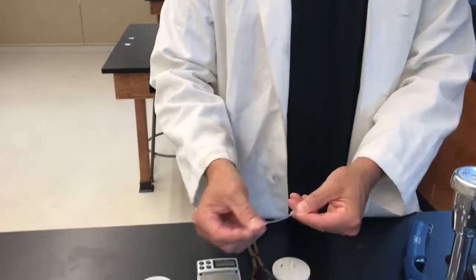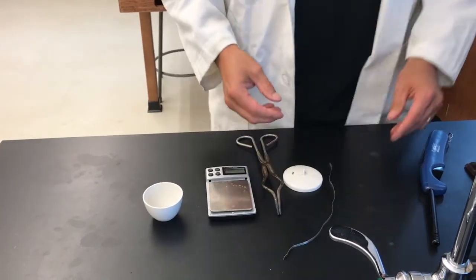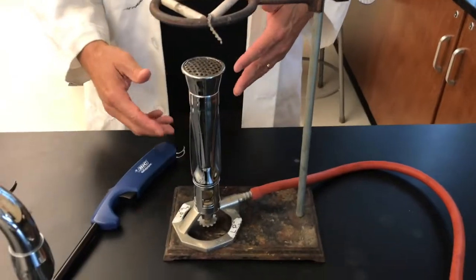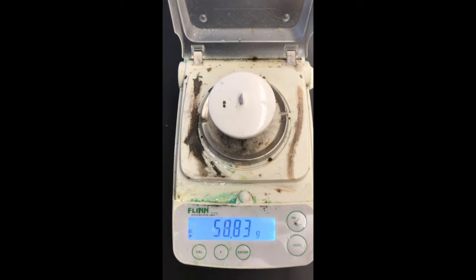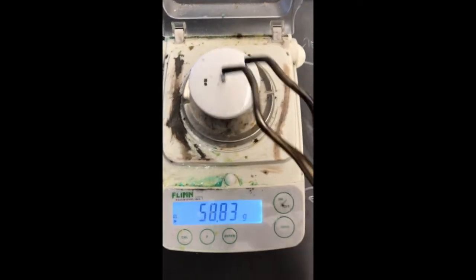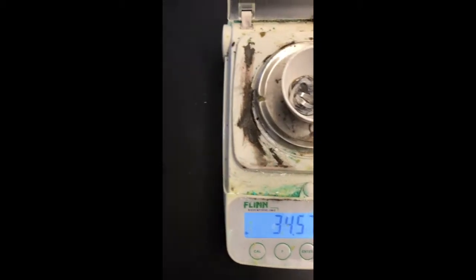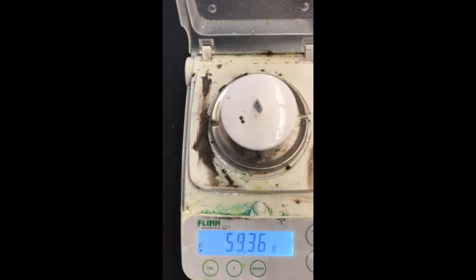Magnesium's pretty malleable. You can tell it's a metal — shiny, high luster, malleable. And then we have a ring stand with our burner. On the scale, we have the crucible and lid. You want to record that: 58.83. So let's now add the magnesium. I'll write this down now. So this is the magnesium, crucible, and lid.